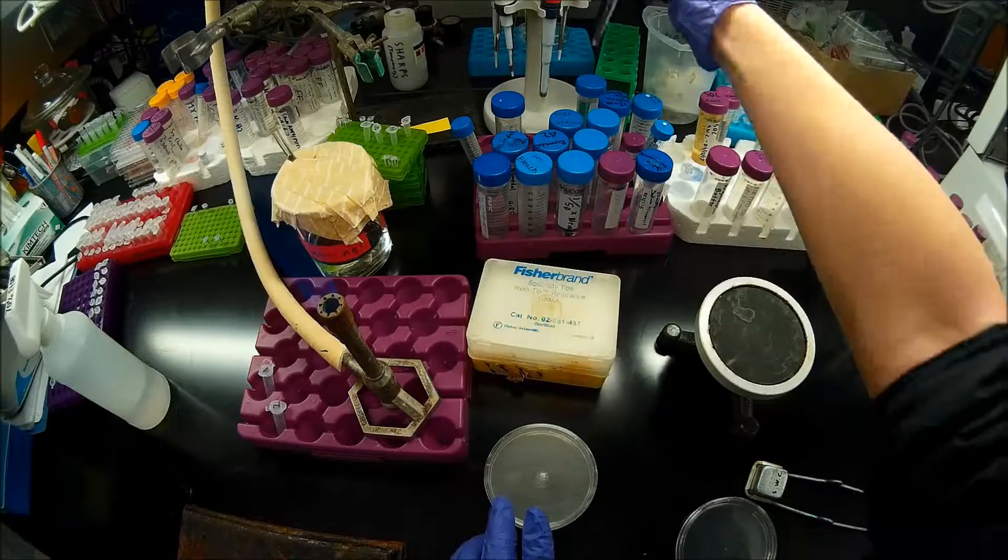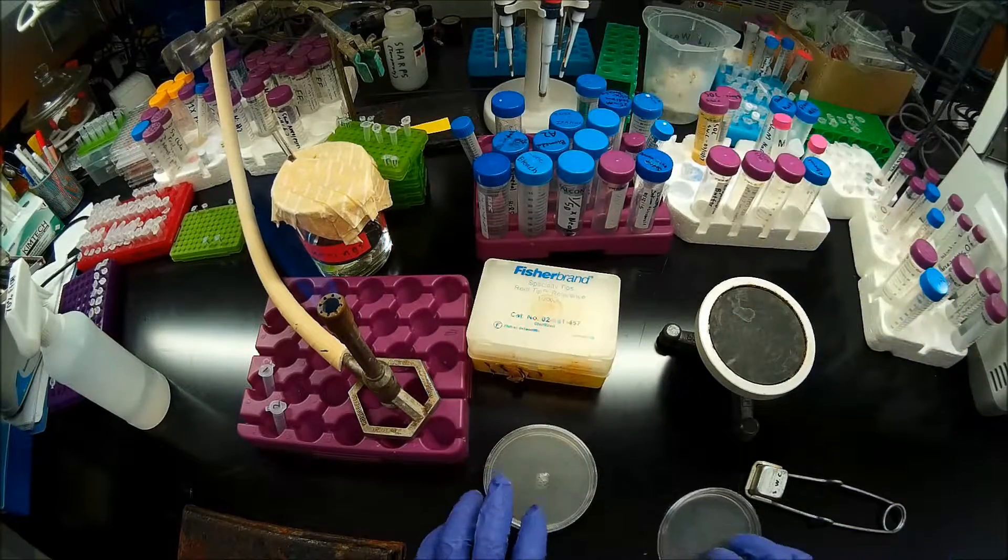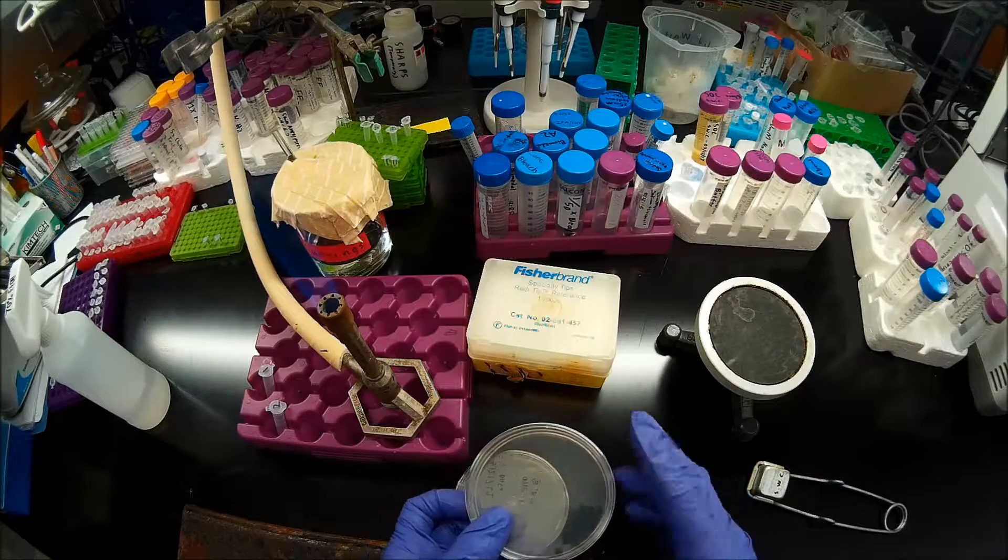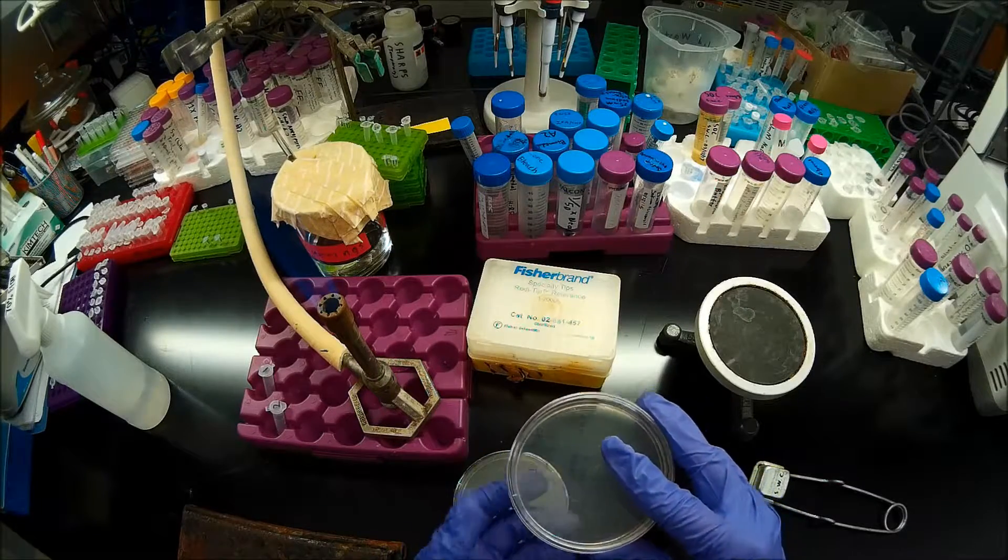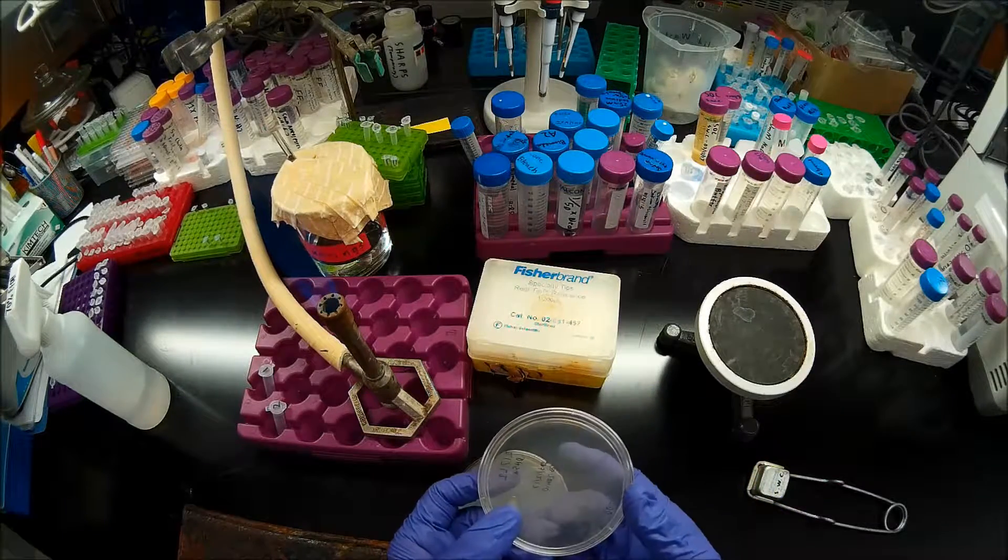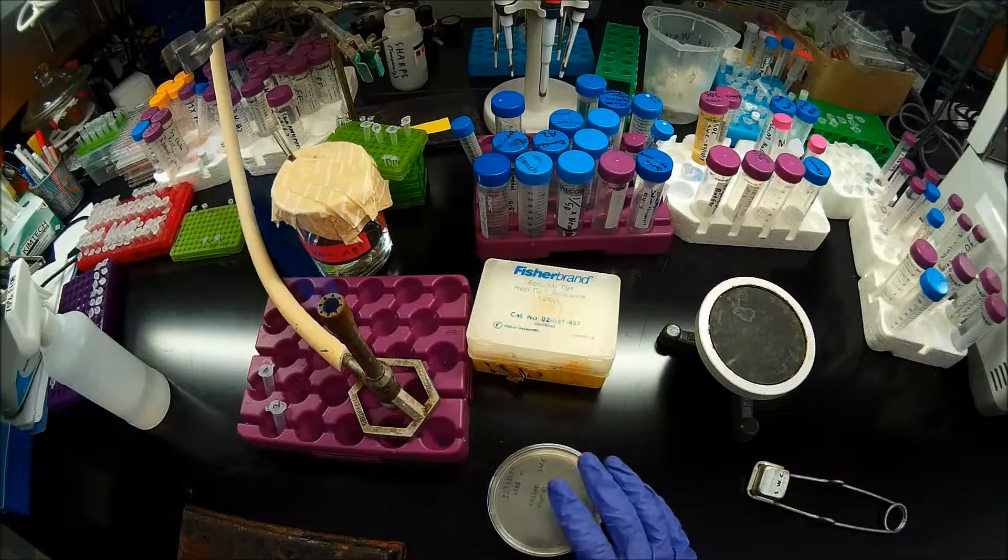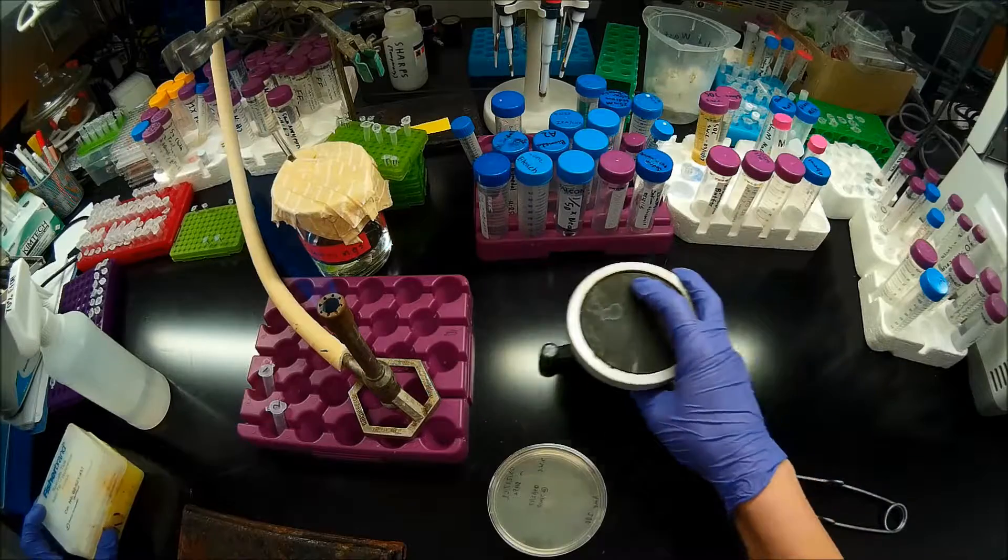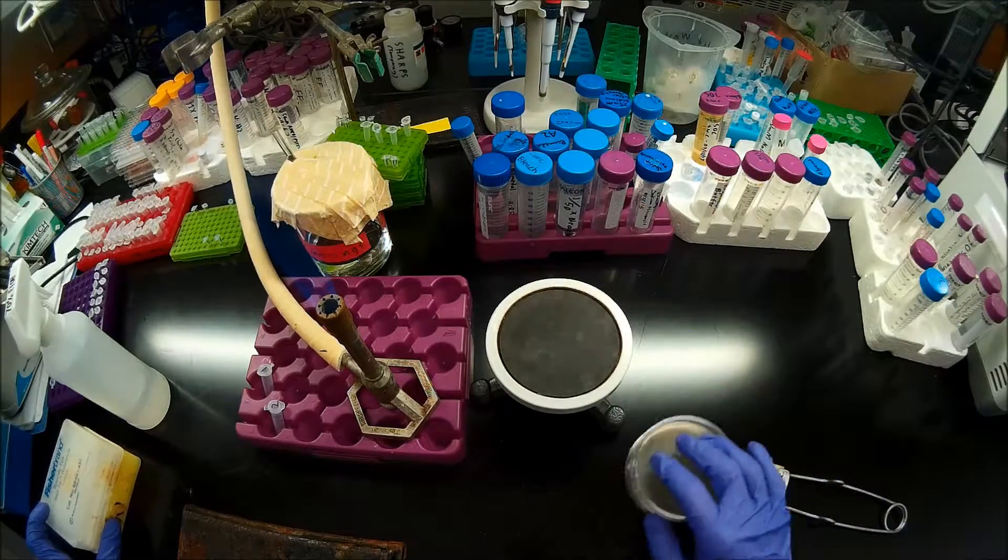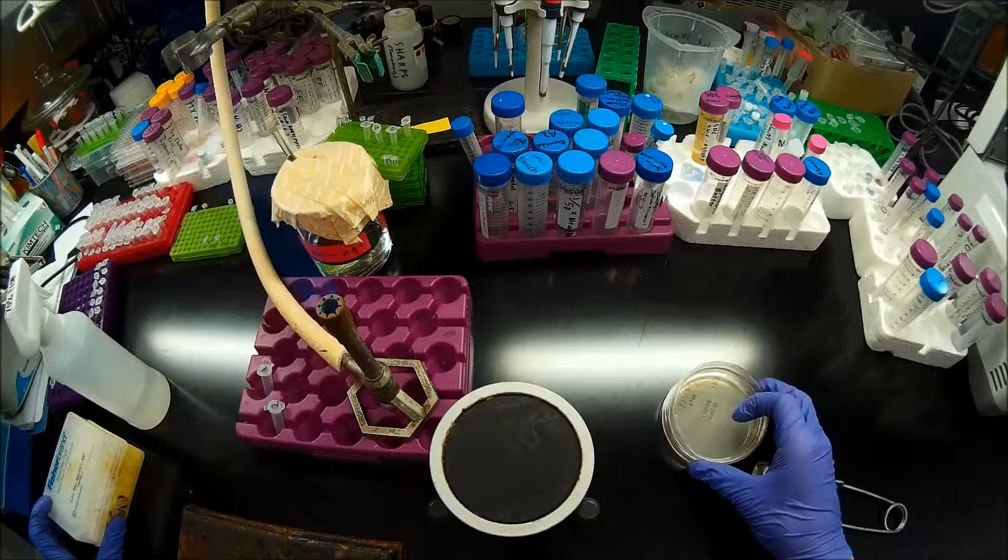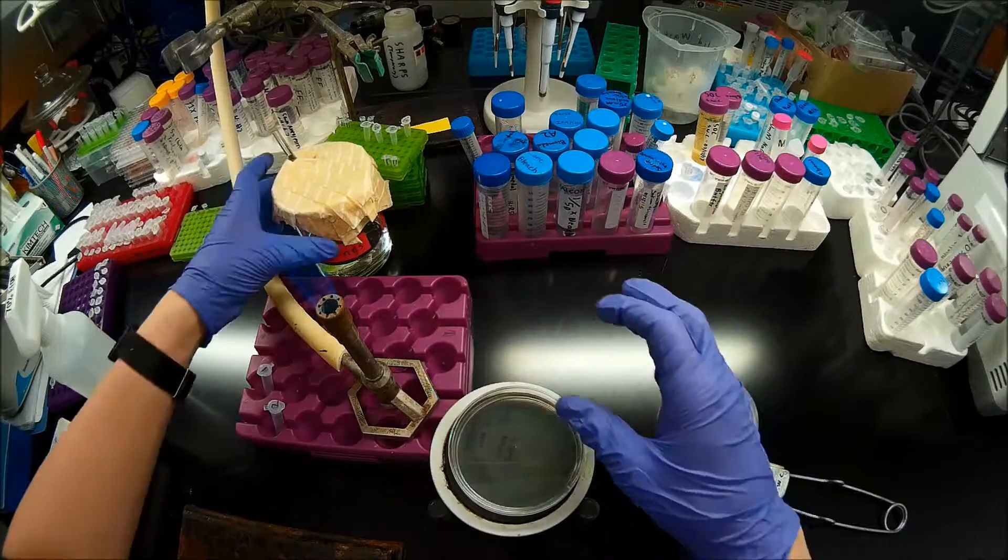So now, I want to spread these cells on the plates. In general, I want to spread them in the same order that I aliquoted them, or as I dispense them onto the plates. That's because that liquid is going to start absorbing into the plates. So here I have a turntable of sorts. And so I'm going to start with the first one that I dispensed.